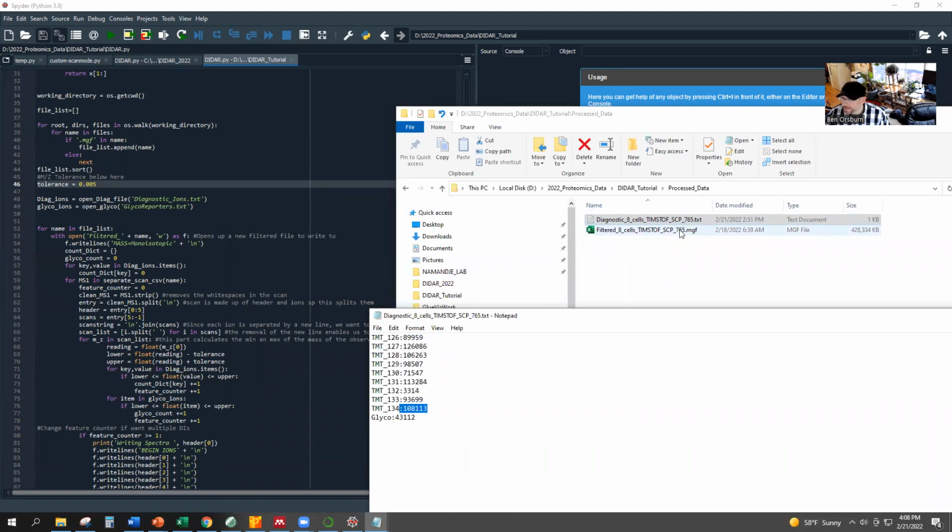You can take that cleaned up MGF and then just search it in any of your normal pipelines for the downstream analysis. But that is all I've got.